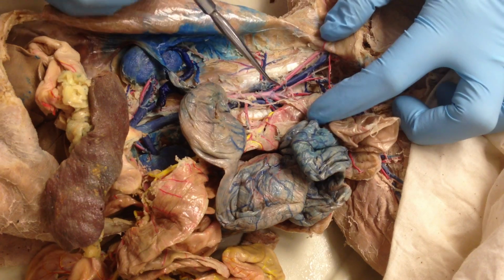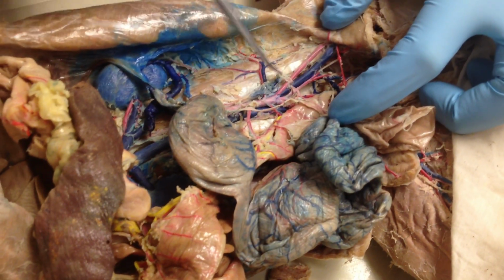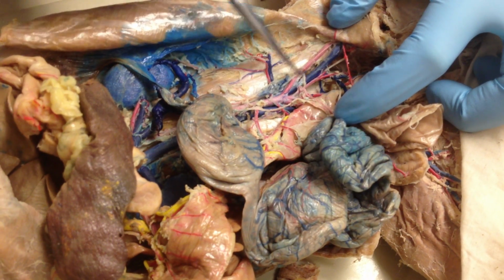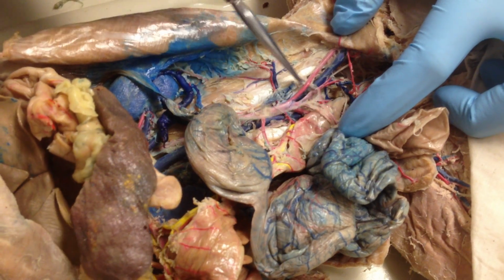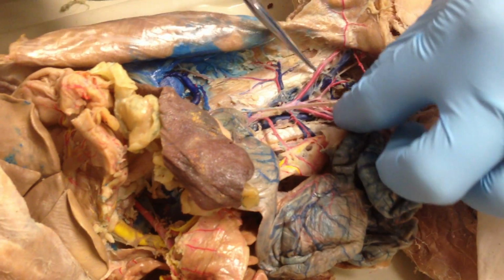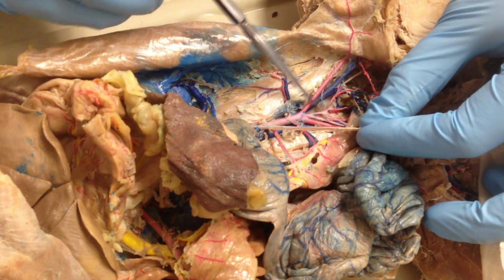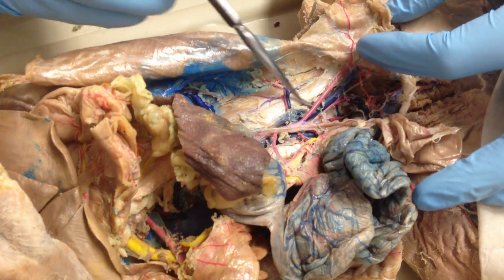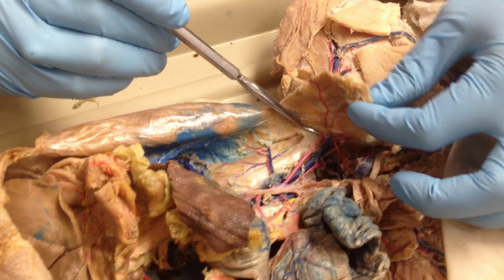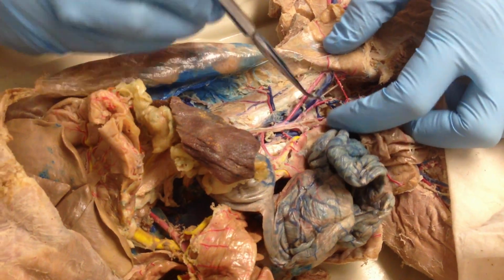And then there's slightly different branching between artery and vein down here. So with the artery, you have external iliac running along here. So this is the external iliac. And the internal iliac is running parallel to it on the inside. Branches separate. This external iliac becomes femoral once it's past sort of this pelvic ridge here, and it's onto the leg.